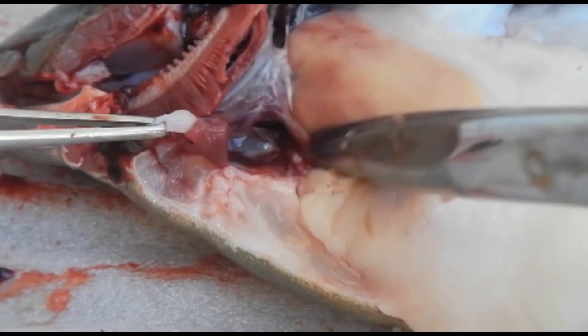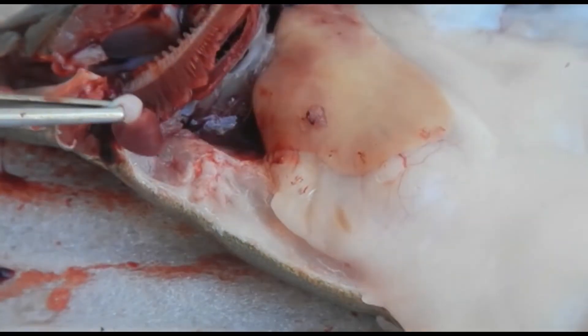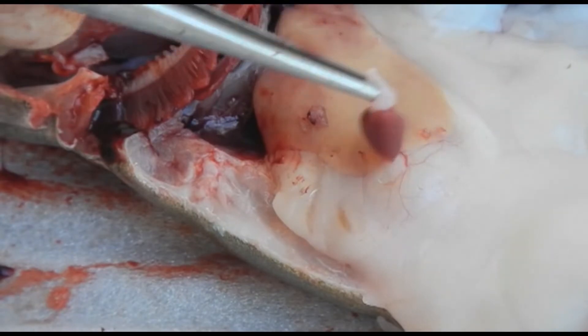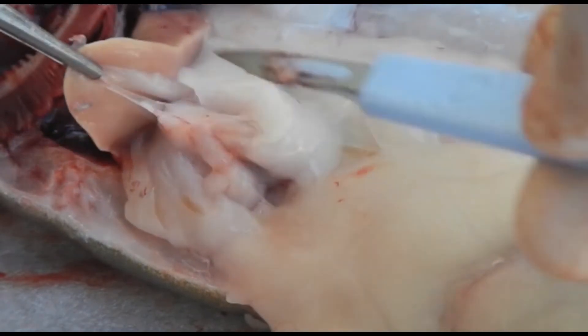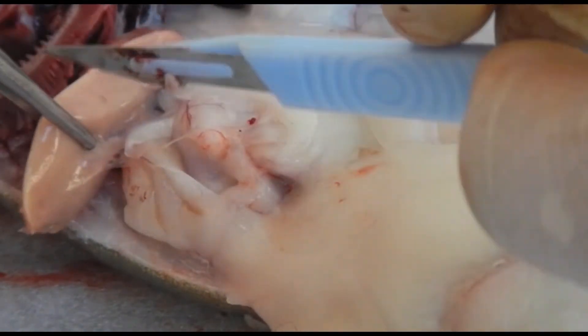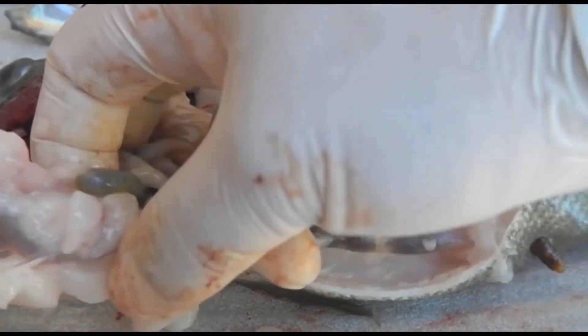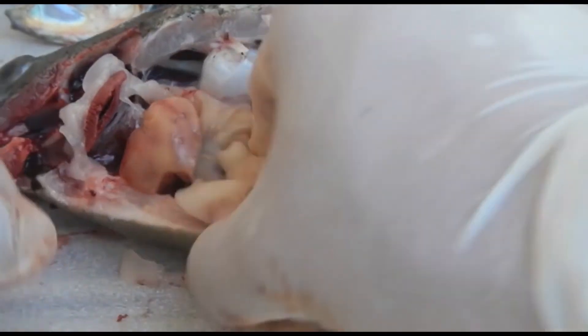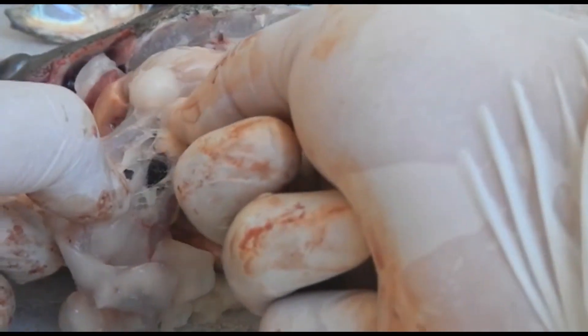The heart is also a great organ because it acts as a reticular endothelial organ, making it useful for detecting reactions to bacterial infections. Now we're dissecting off some of the liver for histology testing as well — make sure you grip the organ very gently. To visualize the rest of the organs, we'll carefully dissect away all this adipose tissue to reveal the gastrointestinal tract.